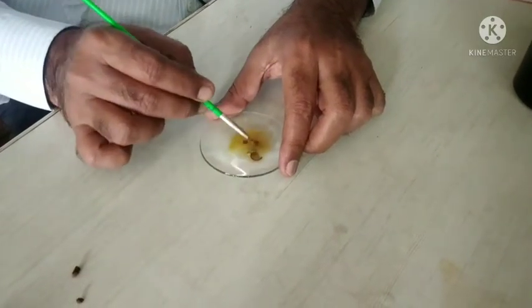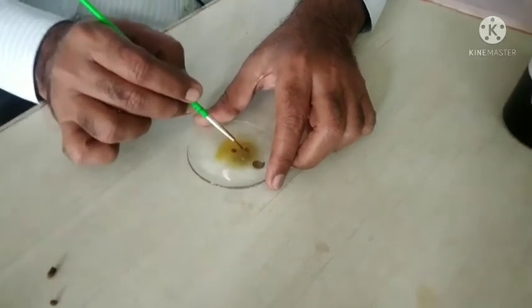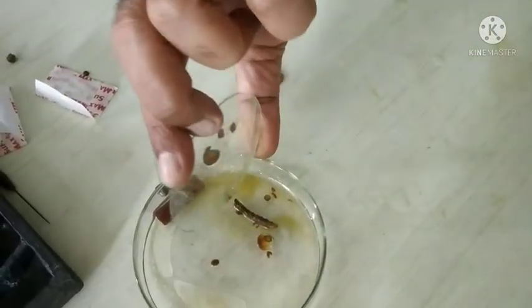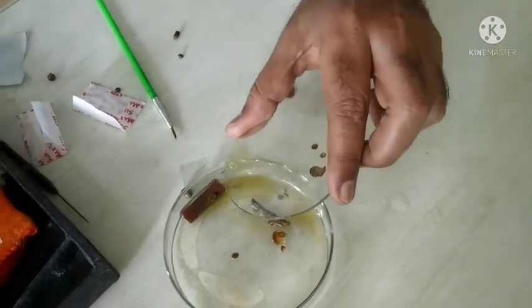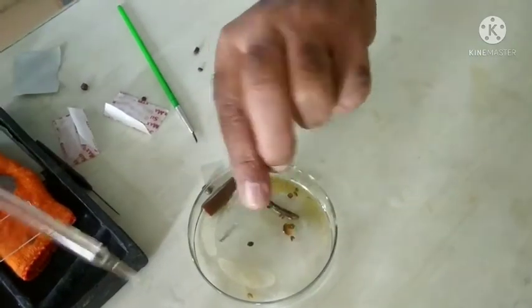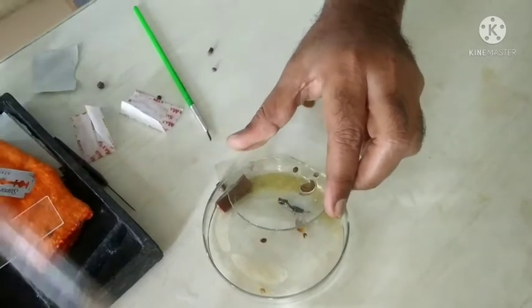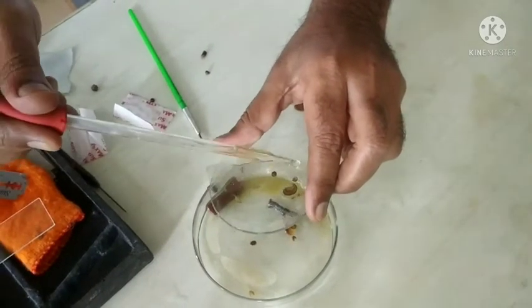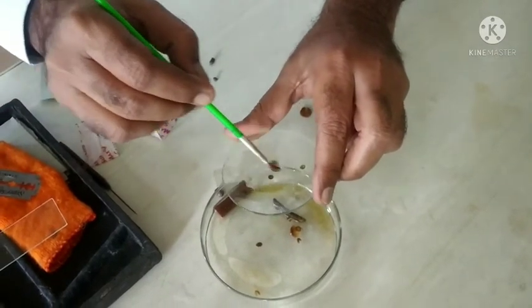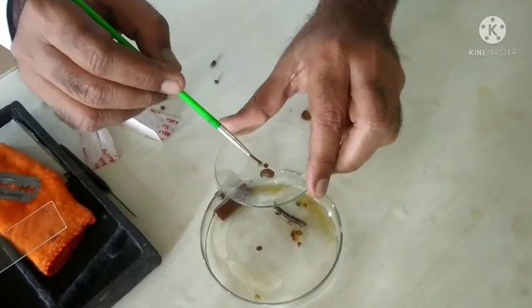Treat the section for 5 minutes. During the treatment, the staining reagent reacts physically, chemically, or biologically, and imparts color to the different portions of the section. After staining, wash the section carefully with the cleaning reagent, which removes the excessive colorant present on the section. Clean it very clearly and neatly, removing all excessive colorant from the section.